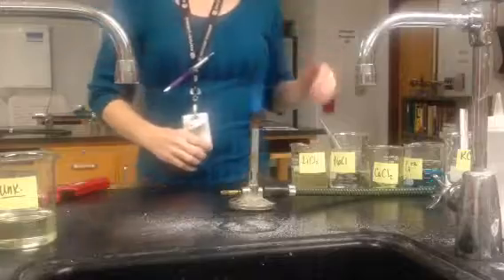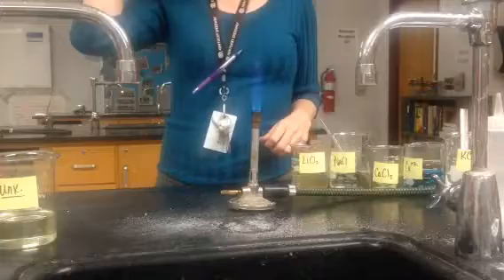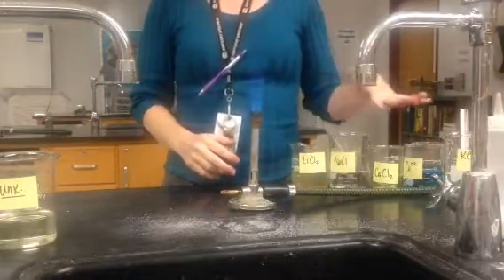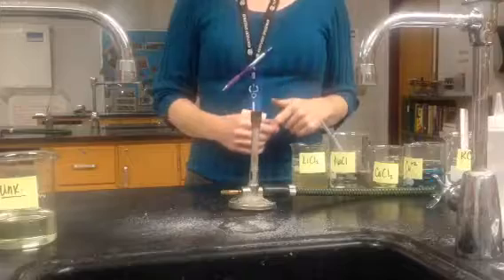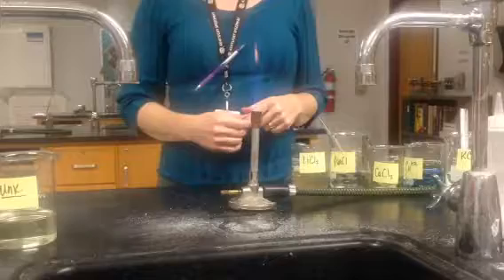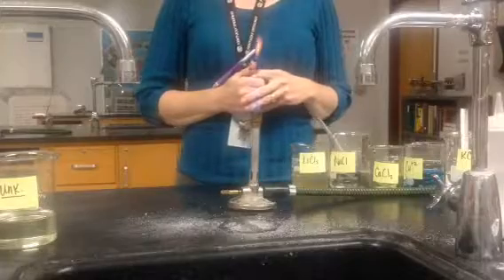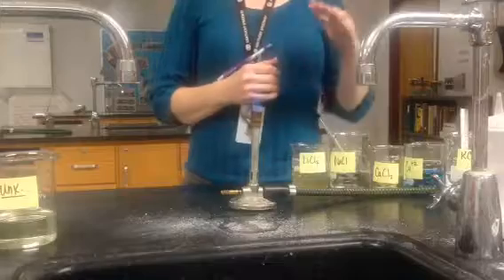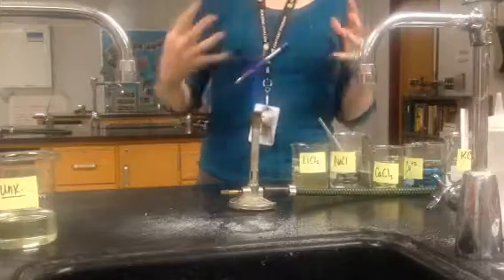For those of you that might have missed our flame test today, I wanted to make sure you did not miss the concepts of what we learned. We had five different solutions. Each of the solutions had a different cation, which is a positive ion. An ion is just a charged particle — that means you've either gained or lost electrons. What we were trying to do in the flame test was to show how scientists can use heat to make electrons change their energy levels in order to give off a certain spectrum, a certain color.